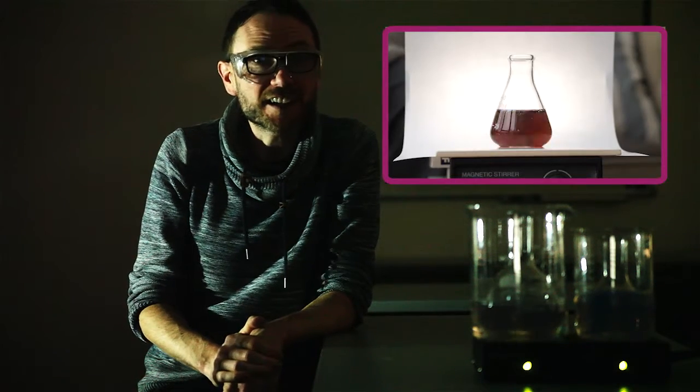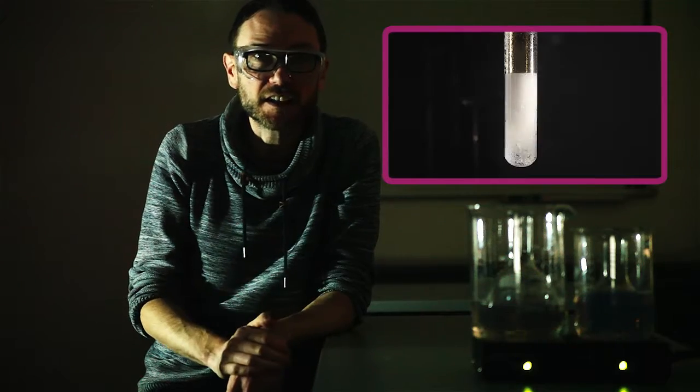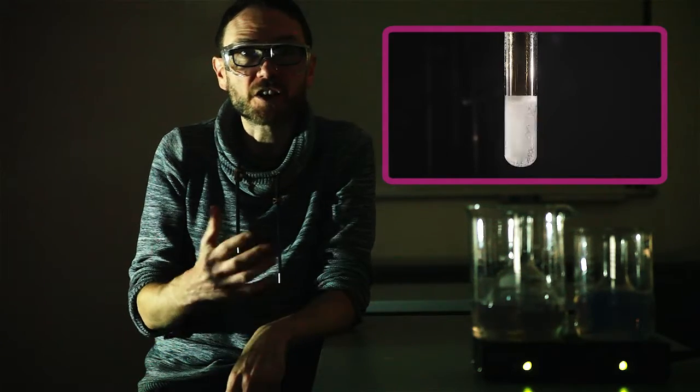In this column we've seen color changes, bursts of fizzing, but this time I want to show you how to make a little luminol lighthouse.